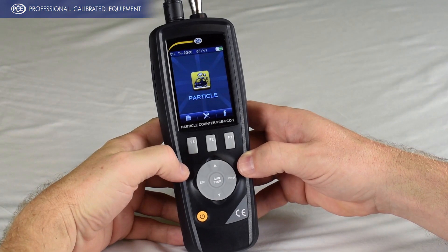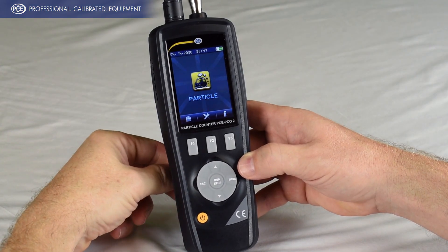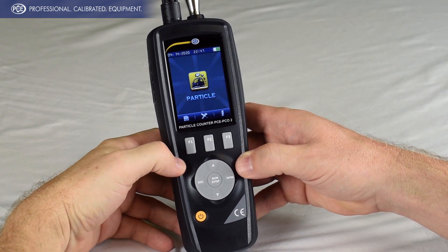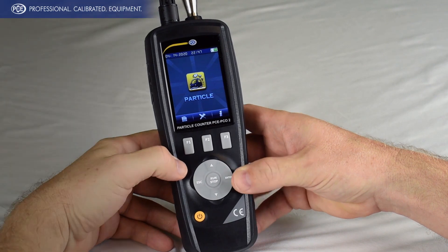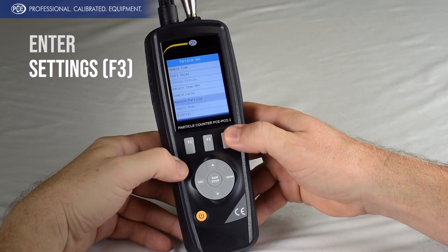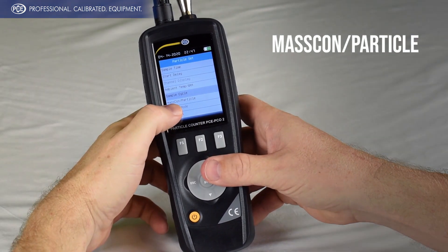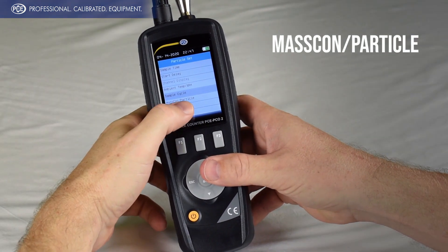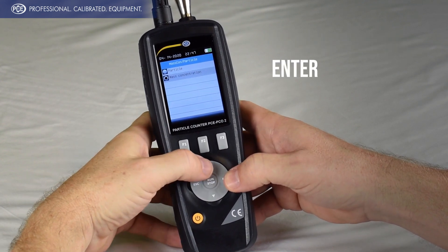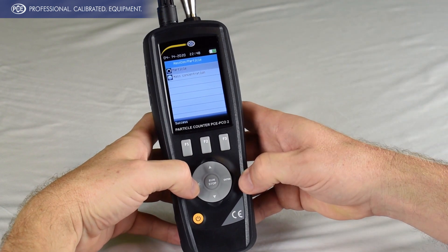The first thing you need to decide is if you're going to run a mass concentration mode, which is the volumetric measurement, or if you want to do a straight particle count. To access that, you'll hit the enter button, then go to settings, and scroll to where you see mass con and particle. Hit enter and then you can select particle mode and hit escape to save.